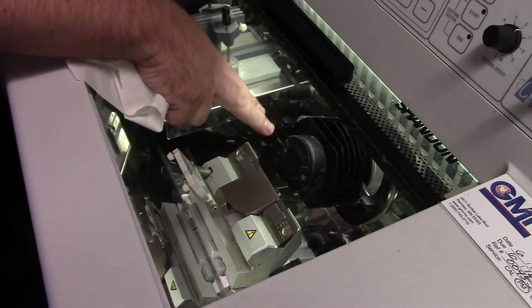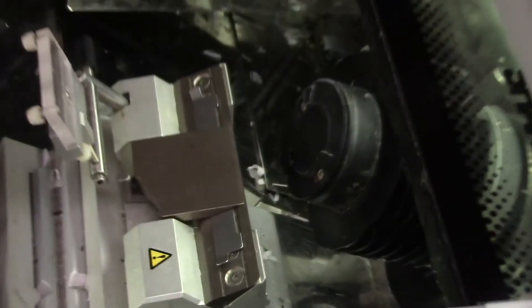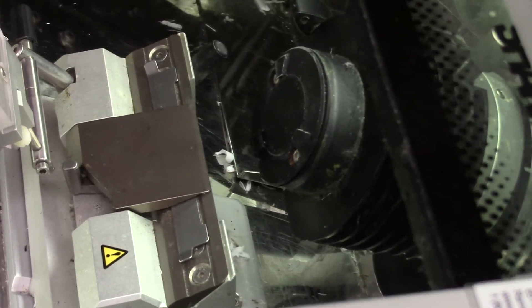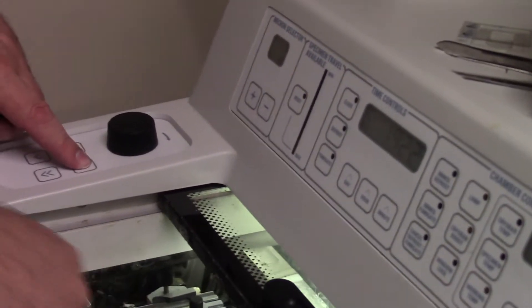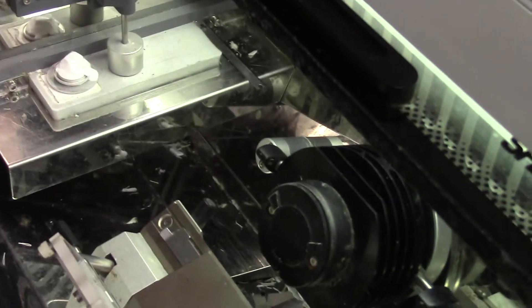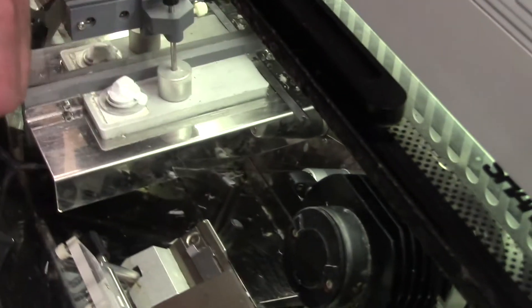What I'm going to do is press these buttons to move the chuck holder all the way back, get it all the way out of line. Notice this bar right here, specimen travel available, three bars. As I keep pushing that away, it says you're nowhere near as far forward as that thing can come. So I've got it out of the way.